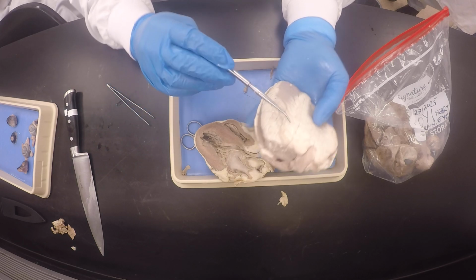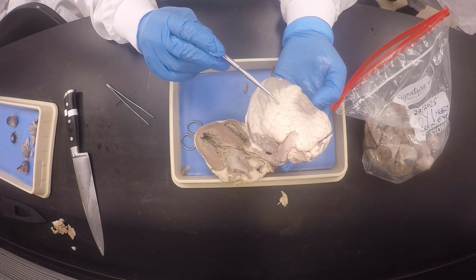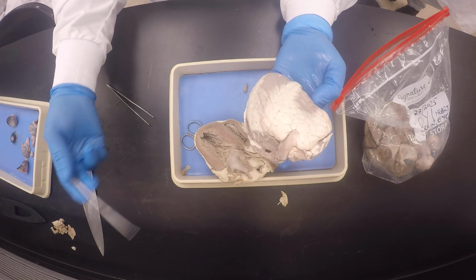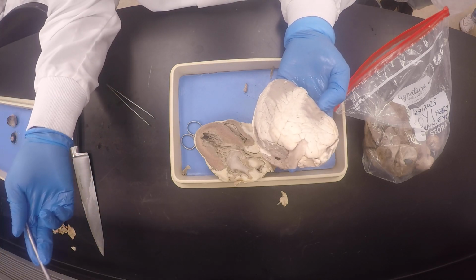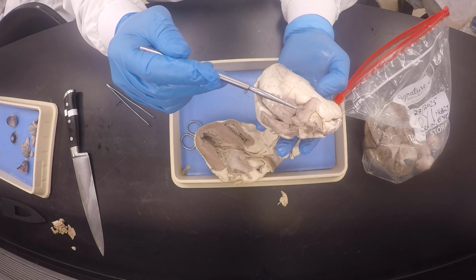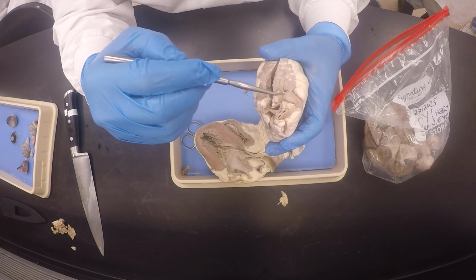Remember, this is our front side, right? Where we've got the interventricular groove like this, correct? I want you to call it the anterior interventricular groove, or anterior interventricular sulcus, because if you say anterior, you know you're on the anterior side. And this is the pulmonary trunk. And you want to see the pulmonary semilunar valve?